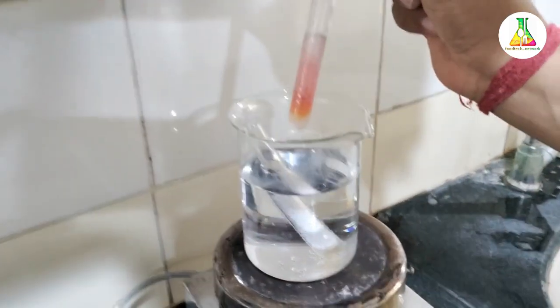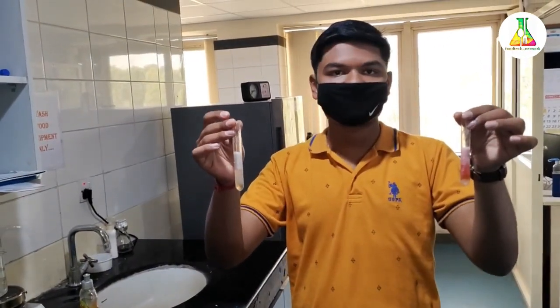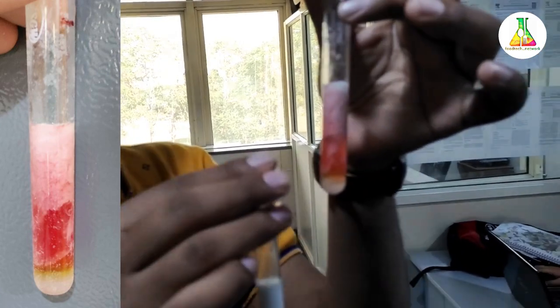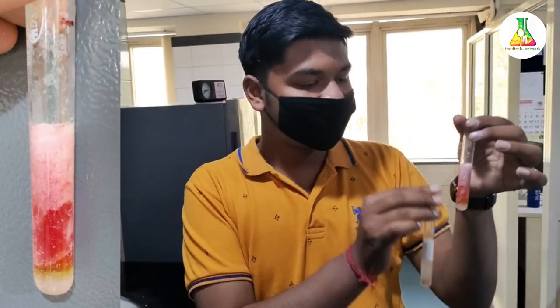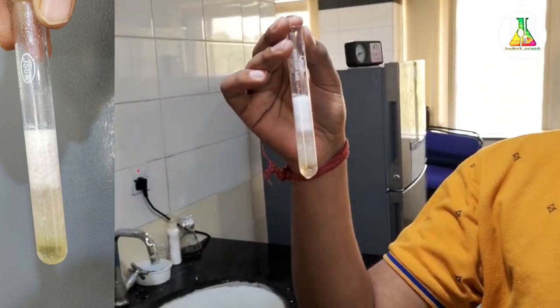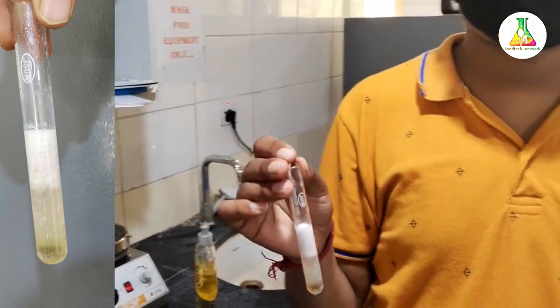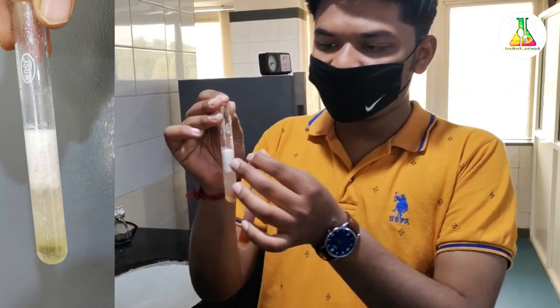You can see the test tube has now gained a deep red color. This is the result of our experiment. On the left test tube — the one adulterated with sucrose — you can clearly see a ring at the bottom ranging from olive green to dark red in color, indicating the presence of sucrose. The other sample, which was not adulterated with cane sugar, has kept its milky white color constant. You may also notice three separate layers in the test tube: this is because the acid coagulates the casein protein in the milk. The bottom layer is acid, the middle is the whey portion, and on top you can see coagulated protein and fat.